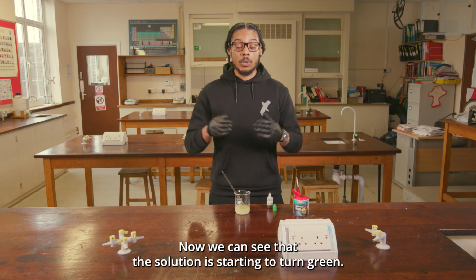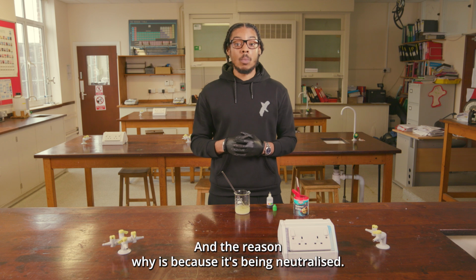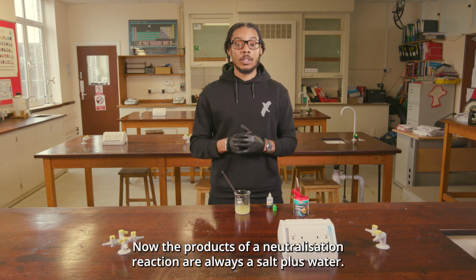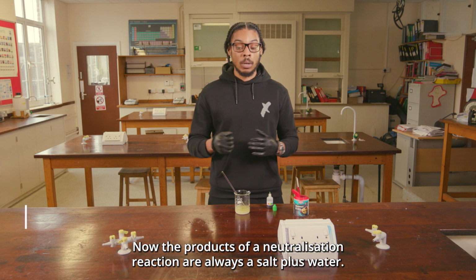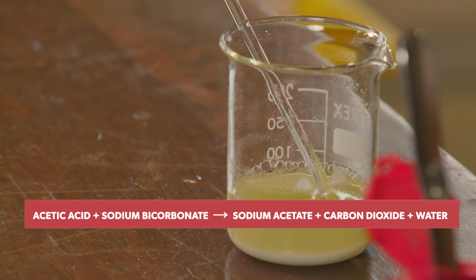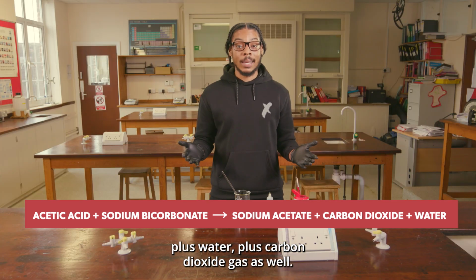Now we can see that the solution is starting to turn green, and the reason why is because it's being neutralised. Now the products of a neutralisation reaction are always a salt plus water. Now in this case, the salt that we produced is sodium acetate plus water plus carbon dioxide gas as well.